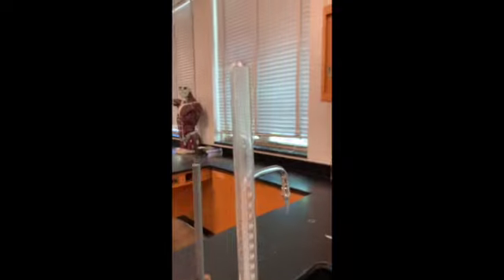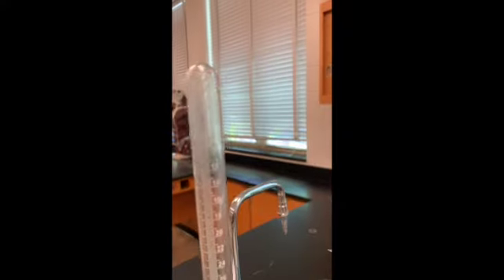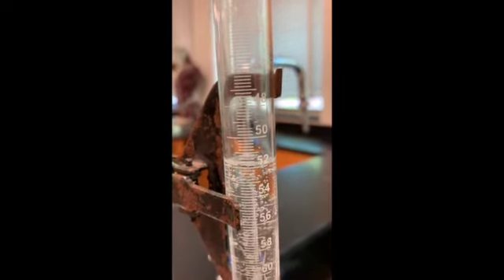Okay, so the reaction has completely stopped, and now we have our desired gas all in the top of our gas collecting tube. And again, this does start counting from 1 and then down. So as far as finding the volume, I'm going to make sure that this, yep, right there, zooms in. That is the volume of our gas.